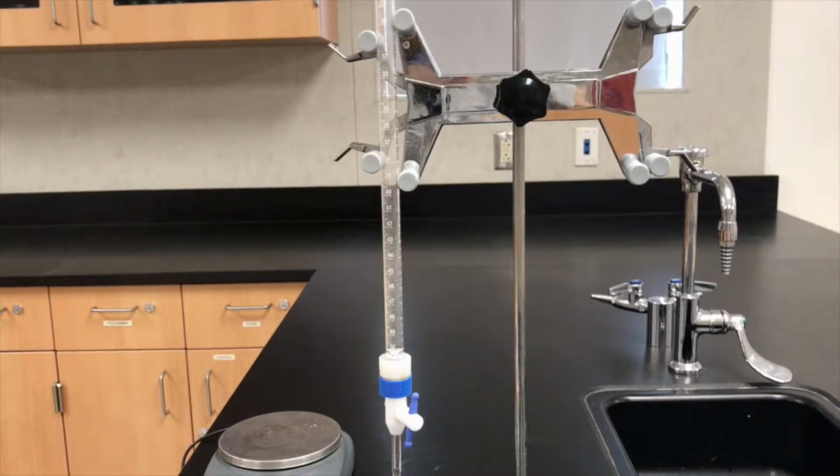So in this video, I'm going to take you through all the steps that you need in order to do your first titration. And then for your second titration, you guys are going to be doing that again in the lab, but it's super similar to this first titration.